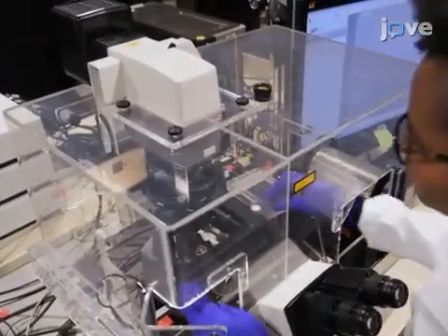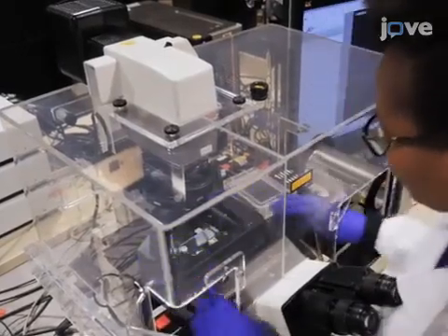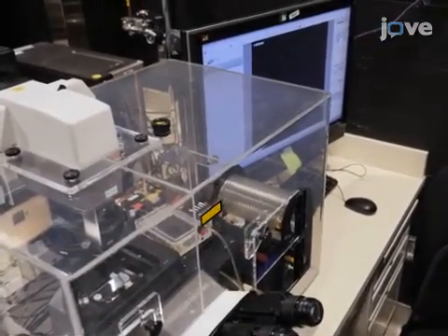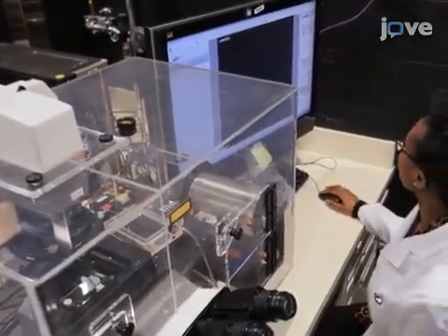Every time the targeting laser is used, it is important to perform a mirror slide calibration to verify that the laser is hitting at the appropriate XYZ coordinates, and to establish the area of the field captured by the camera where the laser can be set to strike.